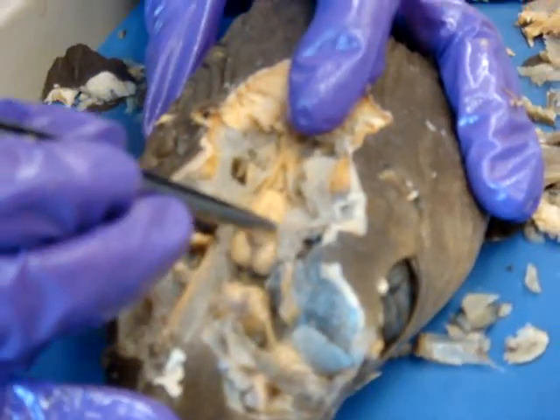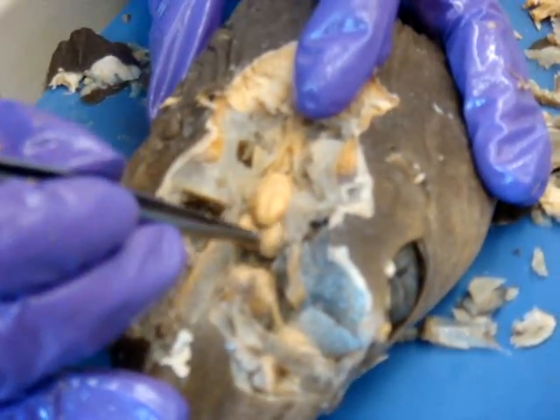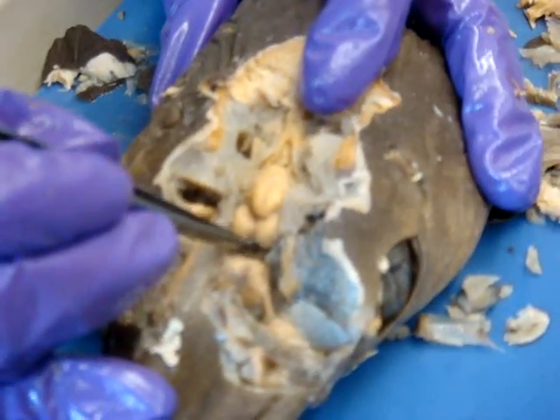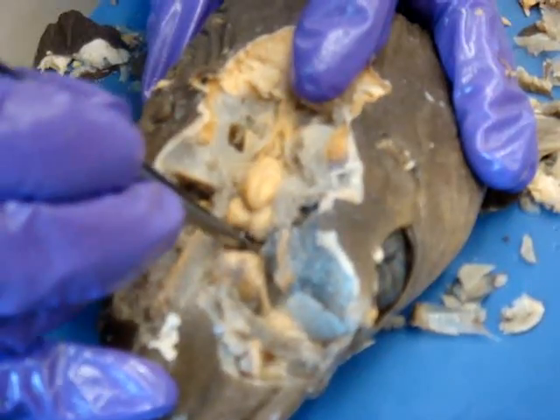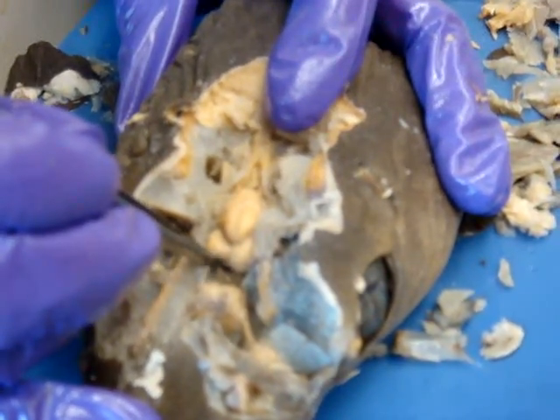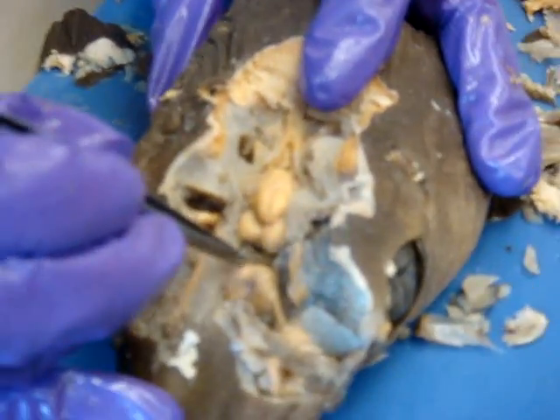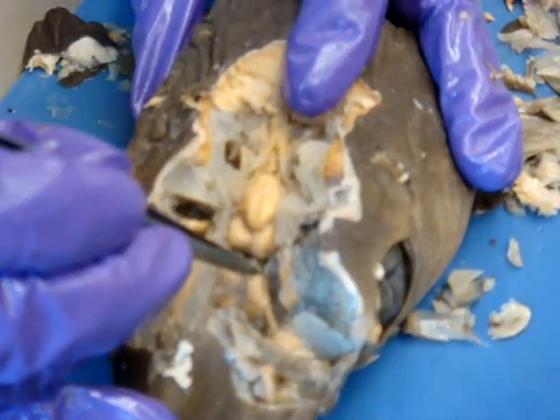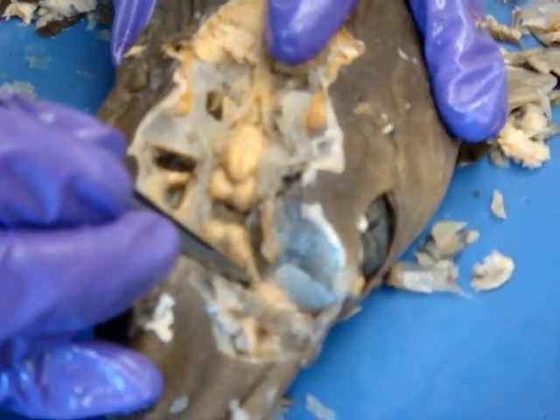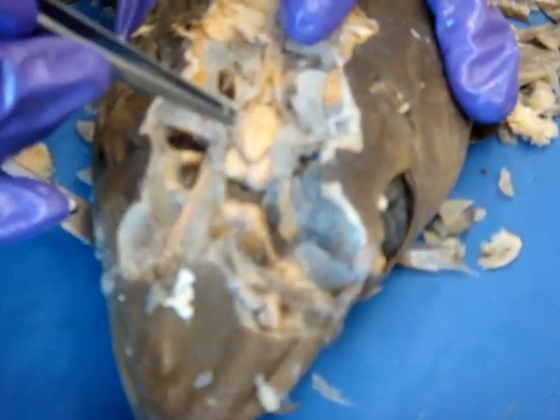So here, this big guy right here is the cerebellum. In front of the cerebellum, these two lobes are the optic lobes. In front of there, there's a space, and that space is the third ventricle. Underneath that space, there is some brain matter, and that is either the thalamus or hypothalamus. You can call it either one. It's composed of both. In front of that, you have the cerebrum, and from the cerebrum, you have the olfactory tract expanding into the olfactory bulb.